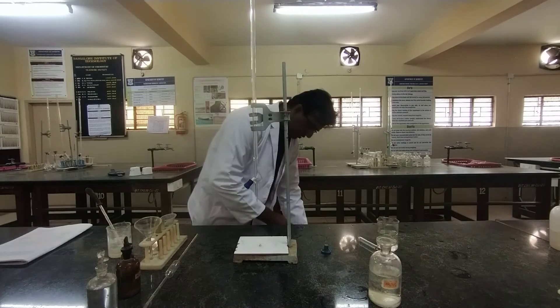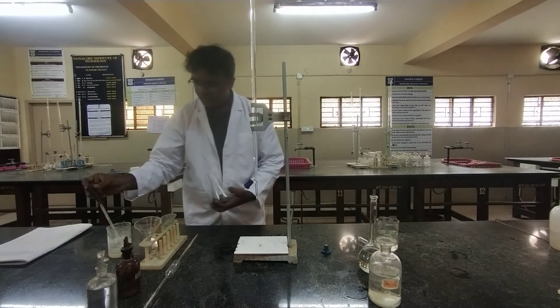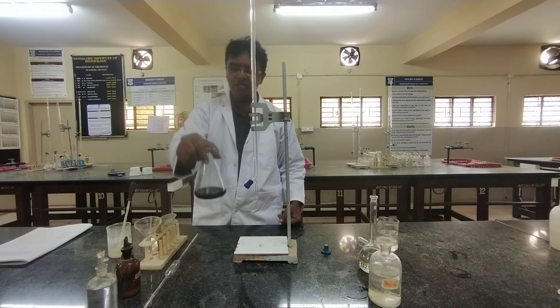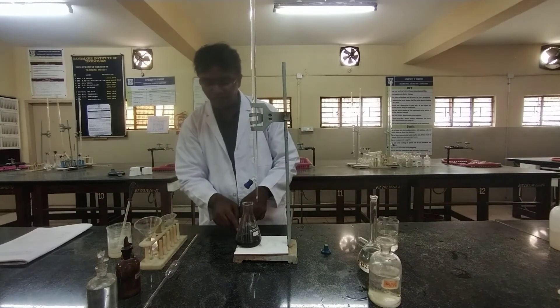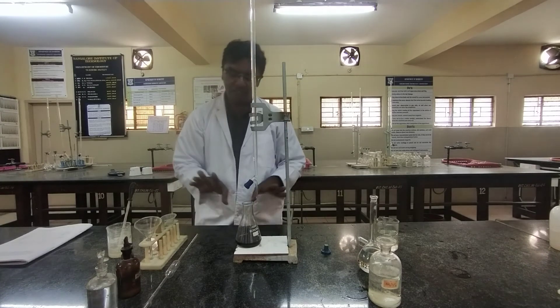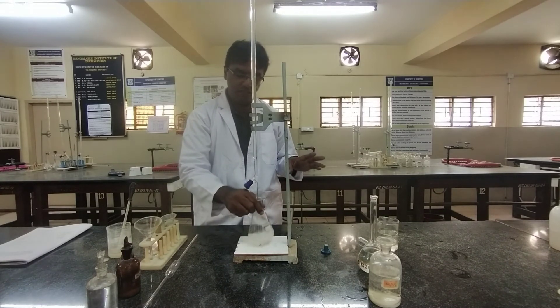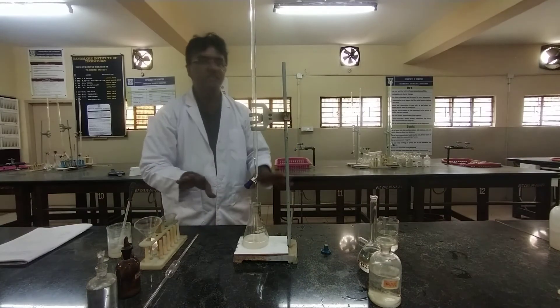When you add 8 to 10 drops of starch indicator, you can observe the formation of a blue color, because starch forms an unstable complex with iodine and that complex is dark blue. Continue the titration until the blue color disappears — the disappearance of blue color is the end point. For example, the end point here is somewhere around 3 to 4 ml.